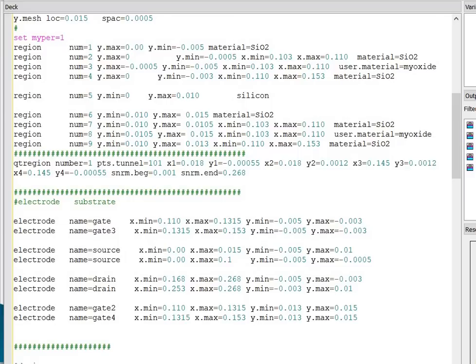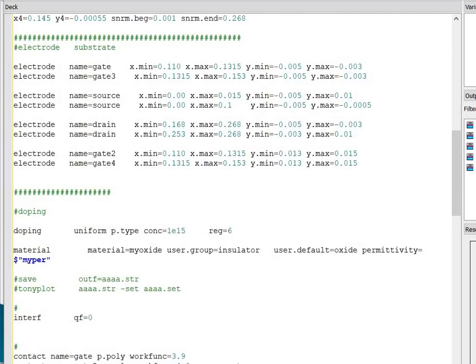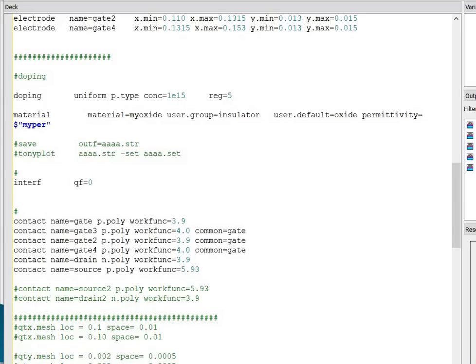Next, I have defined the electrode statement. I am using dual metal gate at the channel region. That's why I have defined gate 3 for the upper side, gate 2 and gate 4 for the lower side. Next, I have defined the source electrode and drain electrode. Next, I have defined the doping. The uniform doping is used at the substrate because we are using the charge plasma technique in region number 6. Sorry, it is not region number 6, it is region number 5.